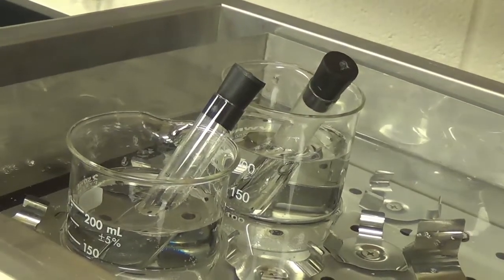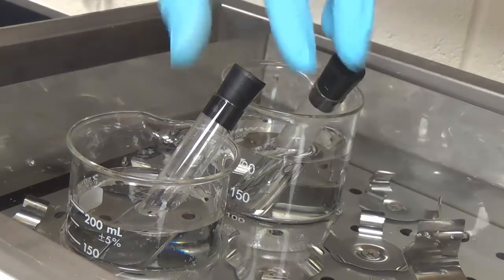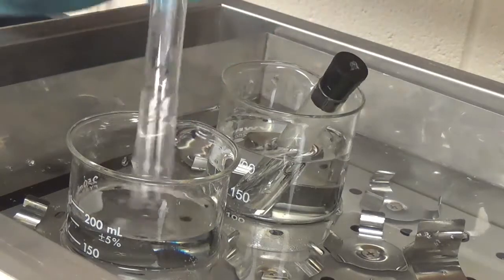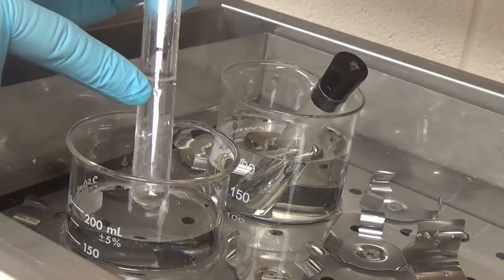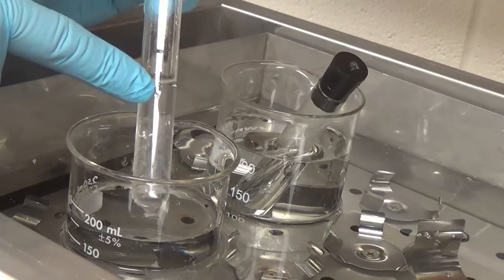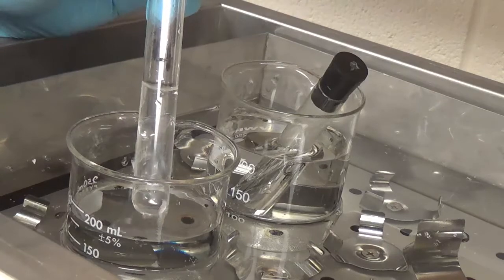So before we start anything, a lot of prep work before we do this experiment, the 4th experiment. This trial run is done at 35, so everything is done at 35. So what we have here is all the materials from experiment 1, so the experiment 1 volumes here, except the K2S2O8, the potassium persulfate.